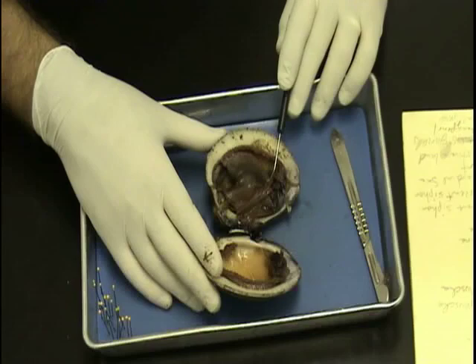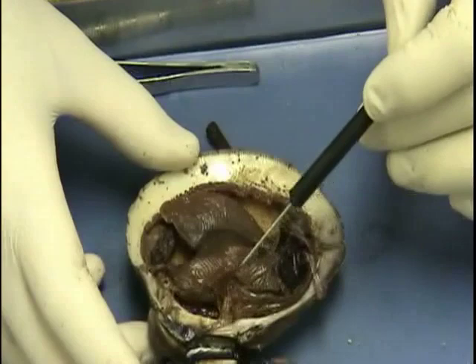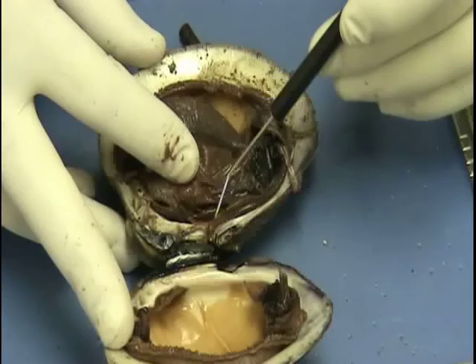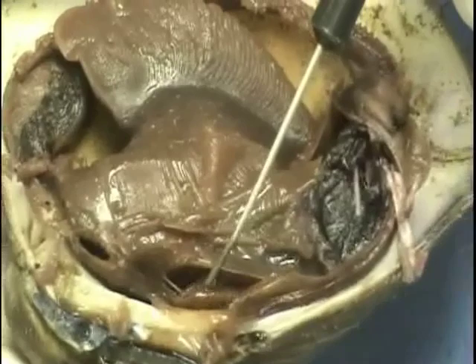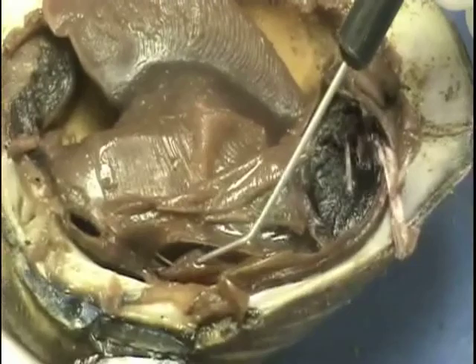Let's do the heart first — the heart and the pericardial sac. If we look just ventral from the umbo here and kind of move part of this gill out of the way, let's see if we can see the heart. Here's the pericardial sac right here — I'm kind of moving that out of the way. That's the pericardial sac. Here is the heart right there. In fact, I'm putting my probe right through one of the openings of the heart. So we've got the heart and the pericardial sac. The pericardial sac covers the heart.